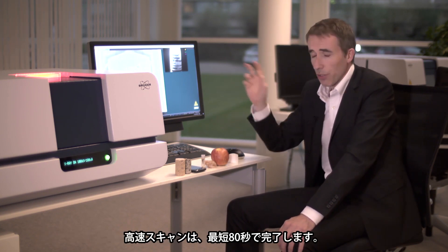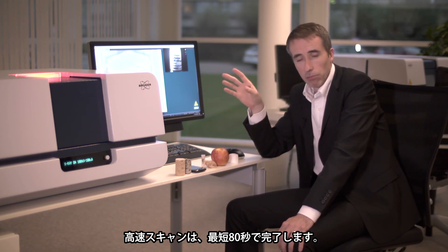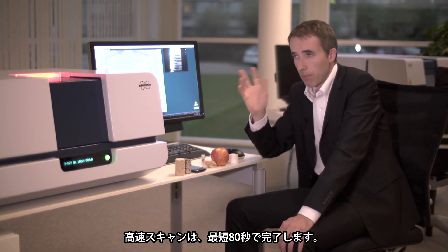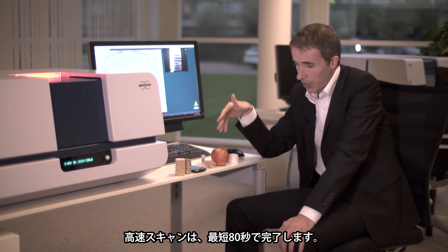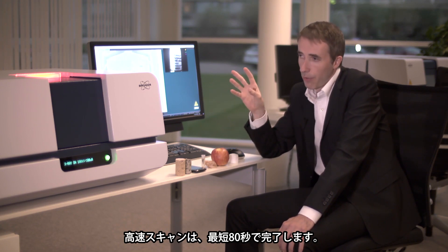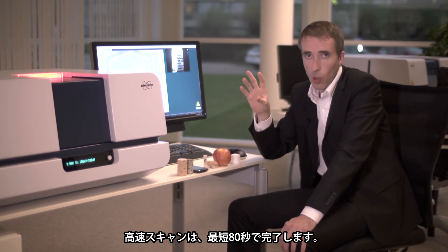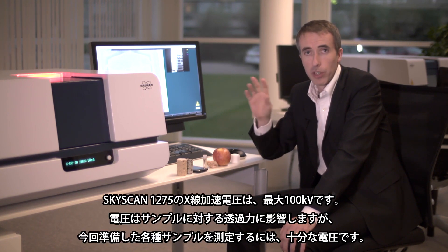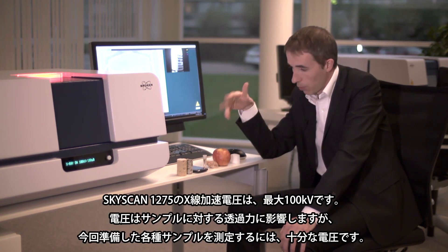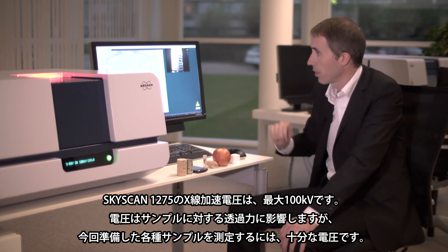The total scan time, as you can see, is very short. It's typically no more than a couple of minutes, depending a bit on the density and the voltage that you have. The voltages of the system go up to 100 kilovolts, which is more than sufficient to scan all these objects that you can see here in front of you.